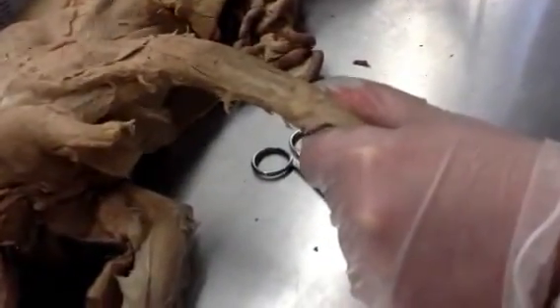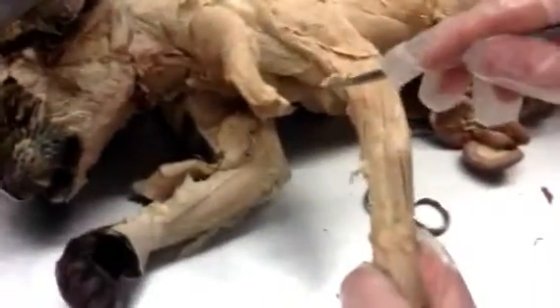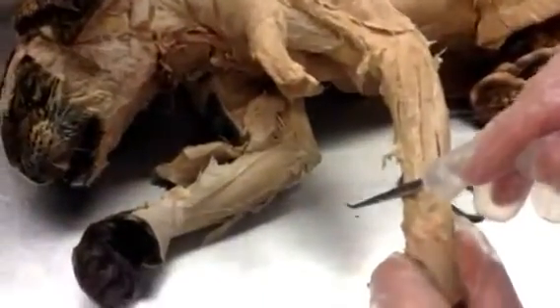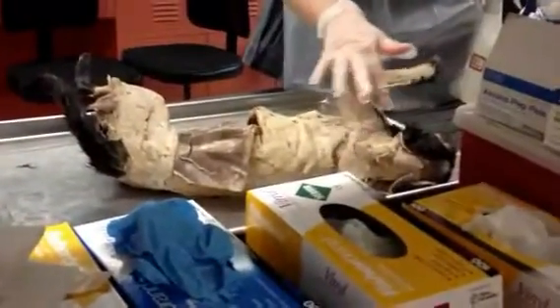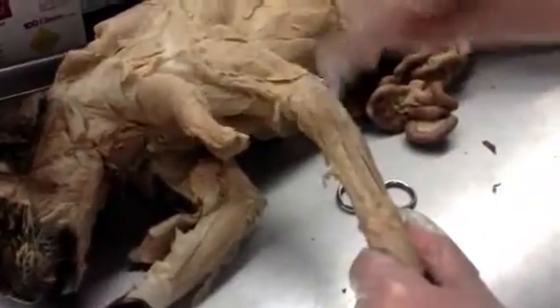This is where the brachioradialis is — it got cut. Remember, the brachioradialis is actually sort of attached to the brachialis muscle. So the way we numbered it, the first one was the brachioradialis. Yeah, that's what Sarah's showing — that's the brachialis. All right, so that's good. Number one is the brachioradialis.